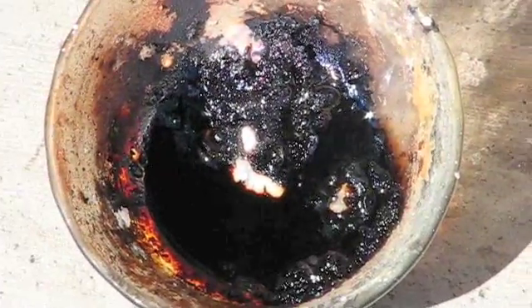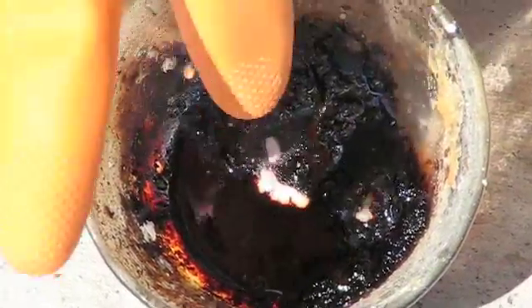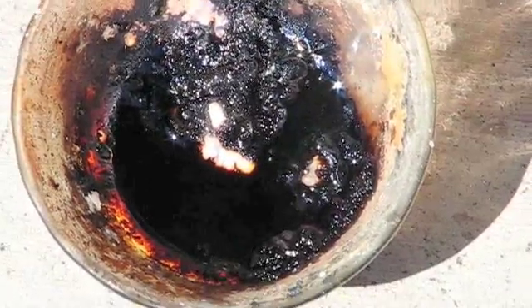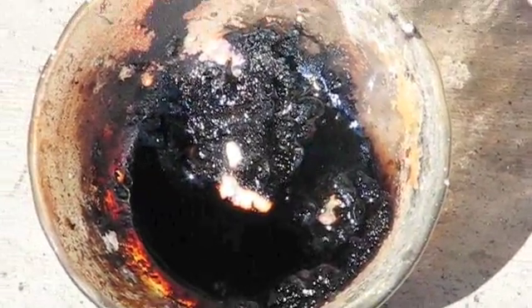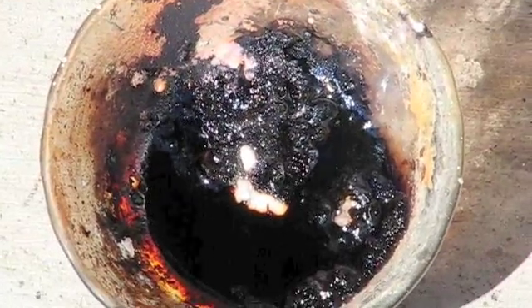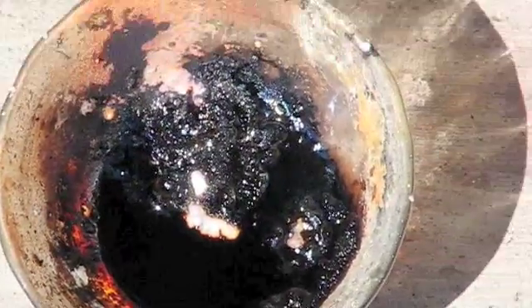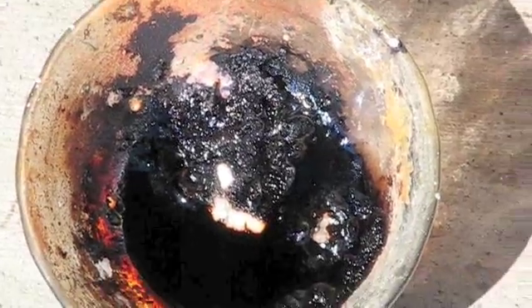What you can see here is the remnants of the reaction. In the center, that white spot we have there — that is sodium iodide, and that's the chemical that was formed from the reaction. Around that, the purple mush we have is wet iodine. So when I drop another piece of sodium in it, the reaction will proceed very, very quickly.